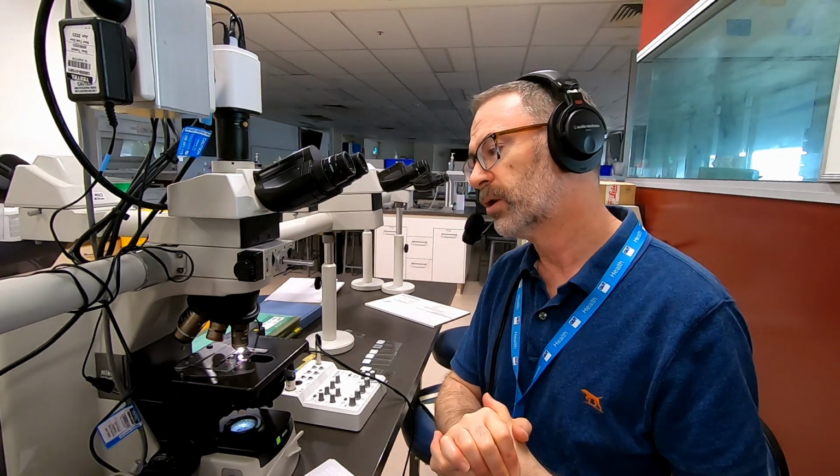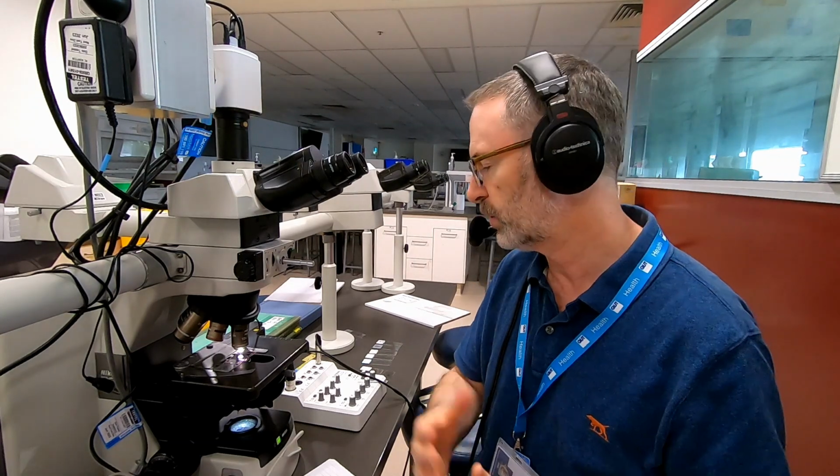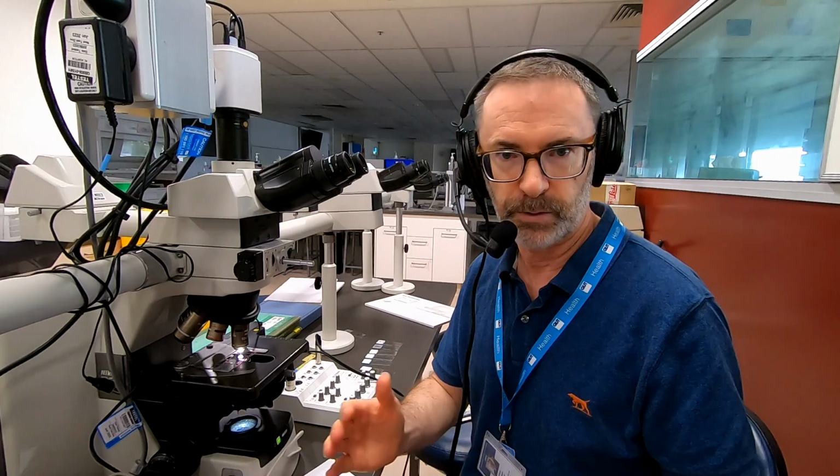We also briefly introduced some simple tests or procedures that can be used to help you identify what those pigments are. And we specifically looked at melanin bleach, in the case where there is melanin present within a section that you may wish to identify through bleaching, or potentially to remove if it's interfering with your ability to see other things.